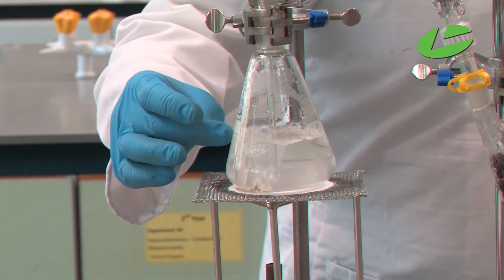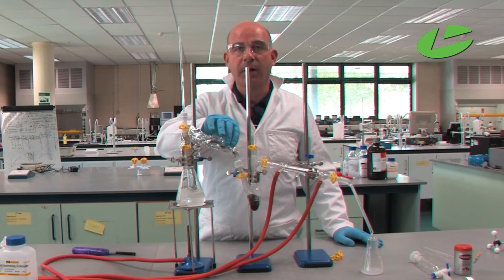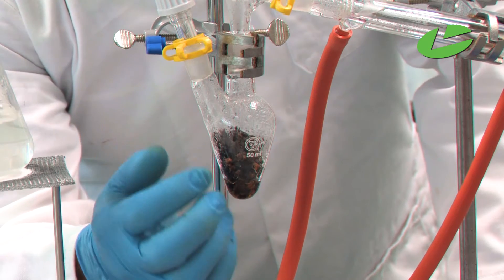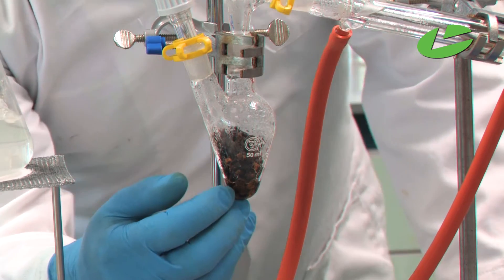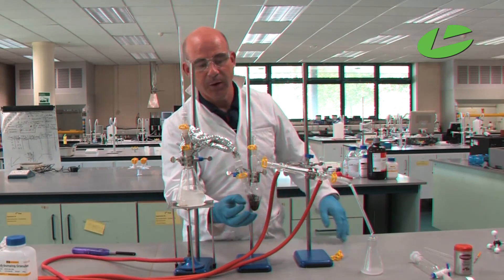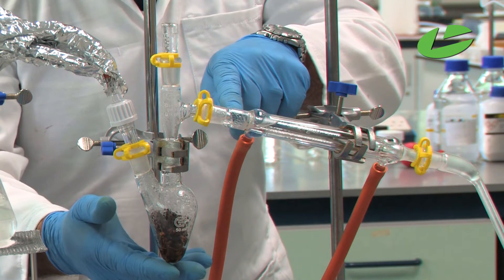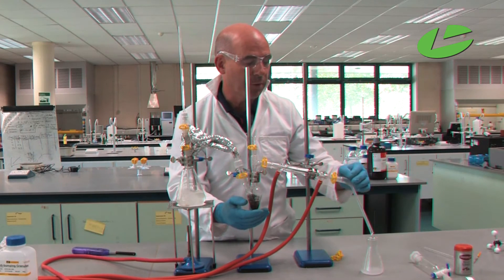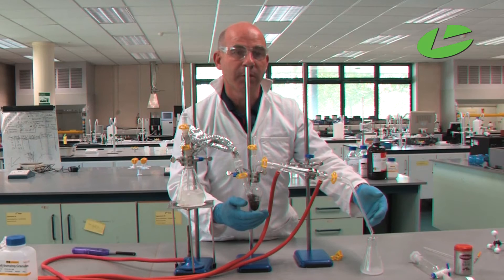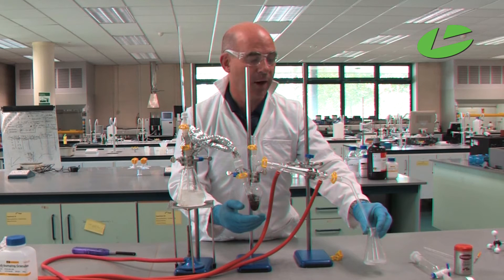You can see our water is boiling. The steam is continuing up into our T-piece, down through the lagged rubber tubing, and you can see condensation forming on the inside of our pear-shaped flask. That steam is extracting the clove oil — the eugenol — from the cloves. The steam then continues up into the T-piece, the vapor of steam and clove oil cools off and turns from vapor into liquid, dropping into our conical flask. We now have an emulsion of clove oil and water collected in the conical flask.